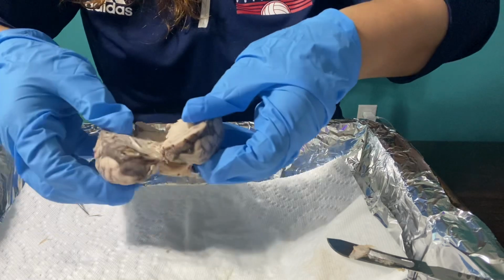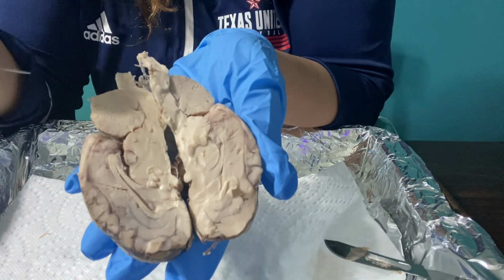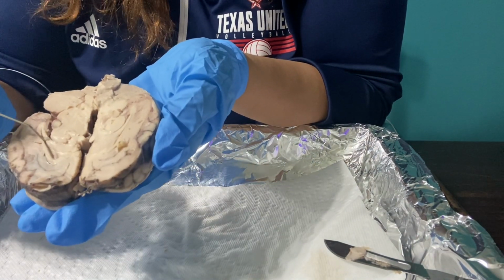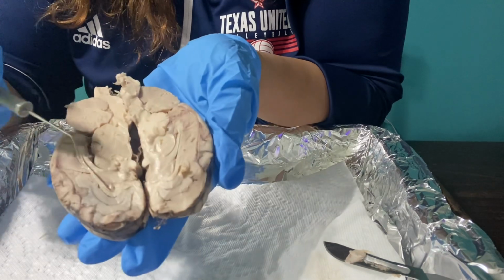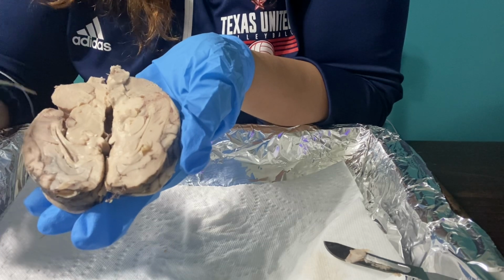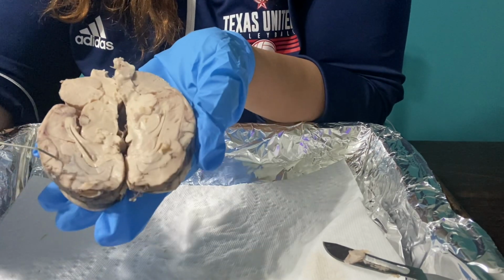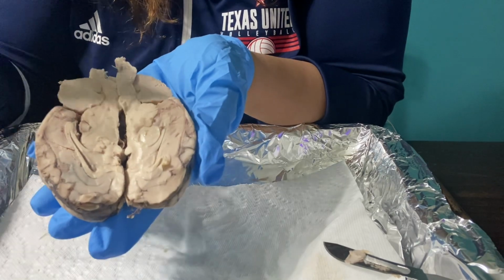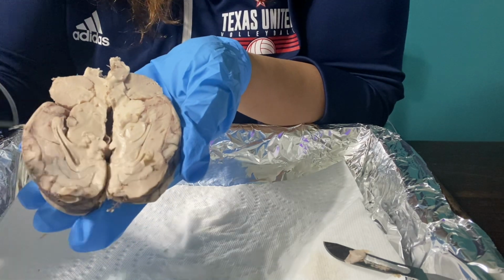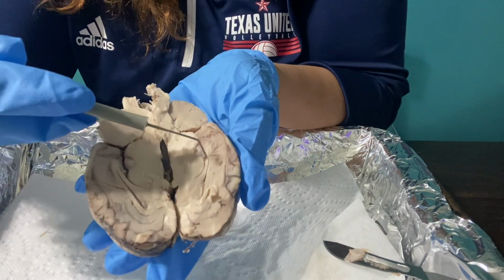Okay, before I wrap it up, I did want to share a few things on the sheep's brain. I want to talk about this light band of tissue that goes from this side to the other side. This, I believe, is the corpus callosum. It is a lighter band of fibers. See, here's a darker part. This is the lighter part. This lighter band of fibers connects the right and the left hemispheres of the brain, allows them to talk, and that is how they're able to give that information back and forth.